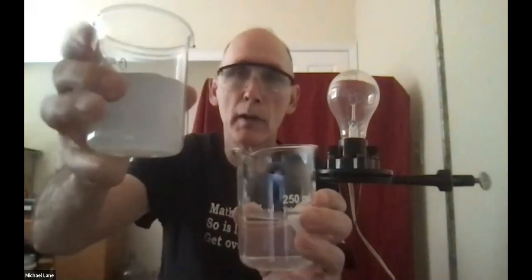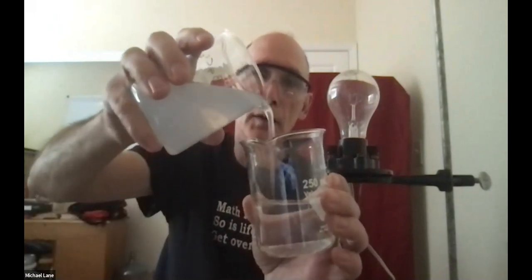Now, what I want you to watch, and of course you can just back up the video if you don't quite catch it, is I'm adding the barium chloride in my right hand into the sodium sulfate in my left hand on 3, 1, 2, 3. And you see the immediate formation of a precipitate.